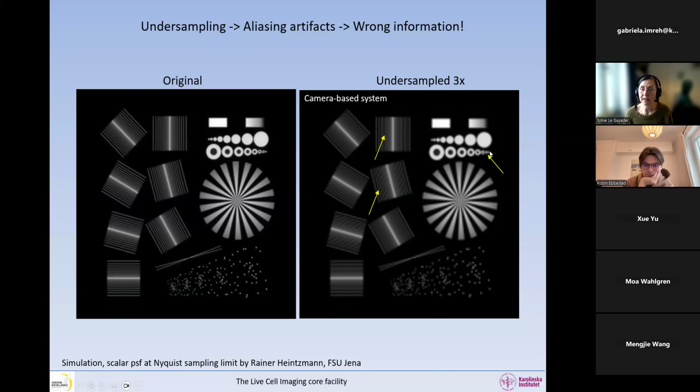And then we can get here, we've lost the resolution. So we are not resolving the optical resolution. The digital resolution is too low. And then you can see in here some strange stuff happening compared to here. So things are fused and they make bizarre bridges. And you can see in here as well, we have pixelation. This is the digitalization process.